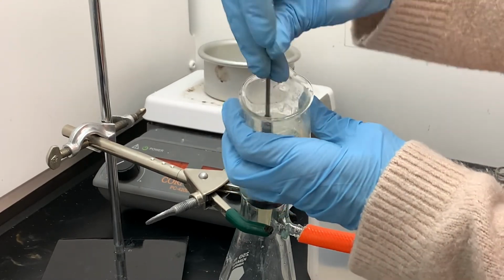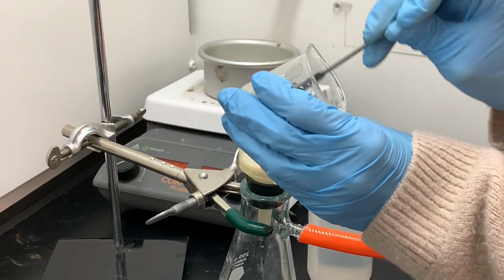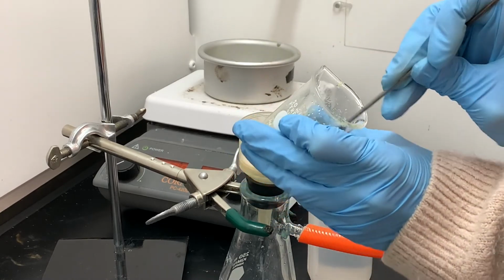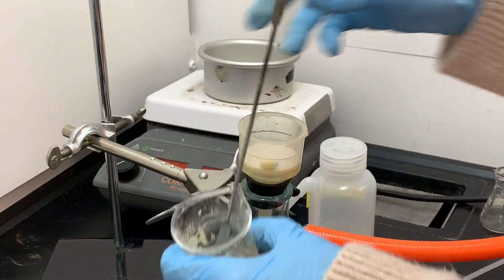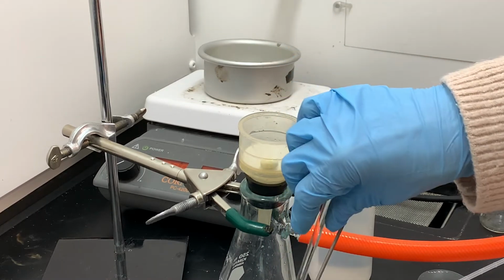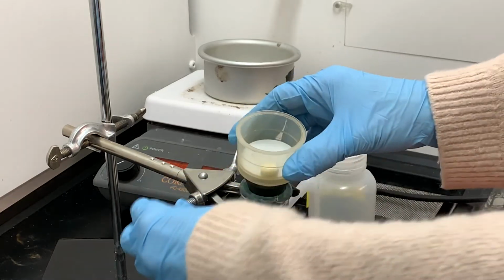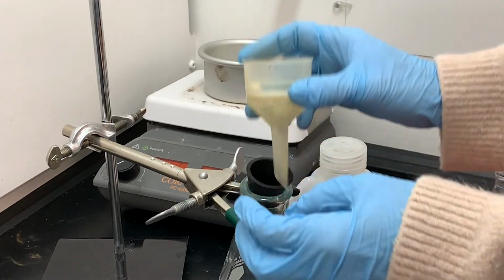And what I'm doing here is collecting it on this little metal spatula to give you a chance to see what it looks like, but also the really small amount that we're working with here. Look at this, hardly any product at all, which is what we expected because we only started with 10 drops of the anise oil. We didn't expect to be collecting very much. So again, I'm setting that aside, I'm not throwing it away. We're going to recrystallize from that, and also from that glass stirring rod, which has a lot of product on it as well. And then we're just going to take a little peek inside this funnel to verify that we really didn't collect anything at all inside the funnel. There's really nothing yellow in there at all, none of our product.